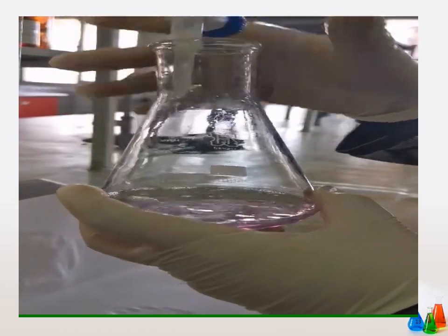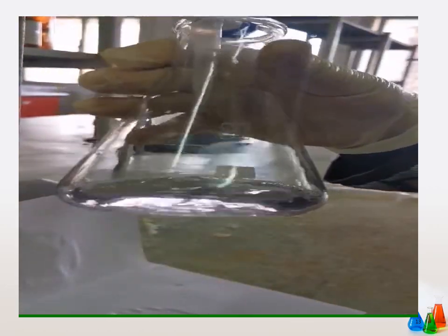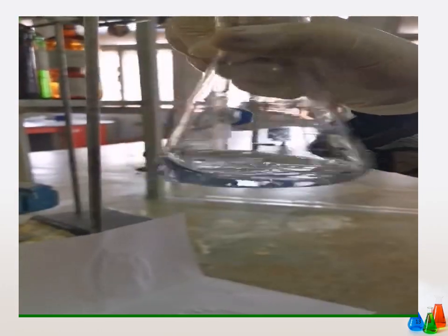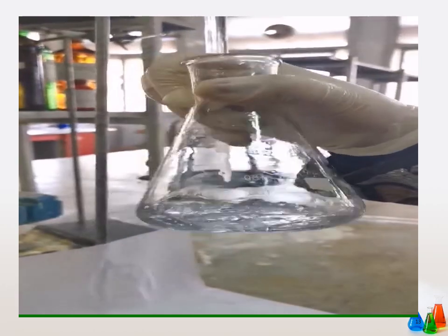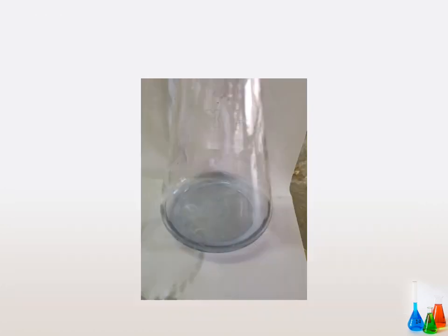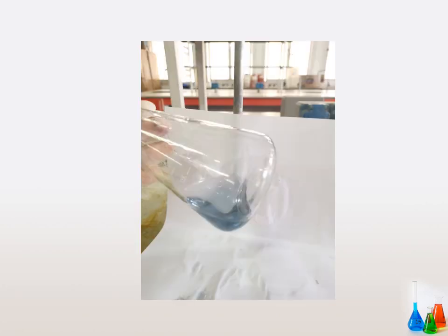So at this point we have to slow down the burette, and this is the blue color which appears and indicates the endpoint. This is the blue color which appears. The first blue color is the endpoint.